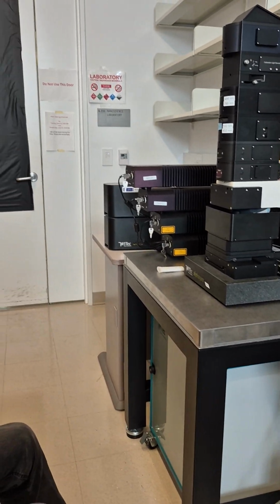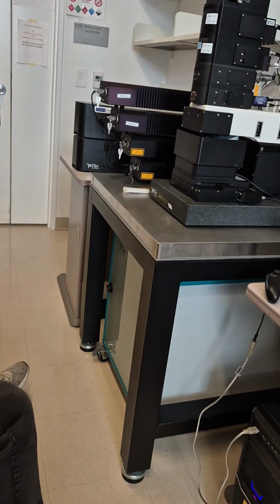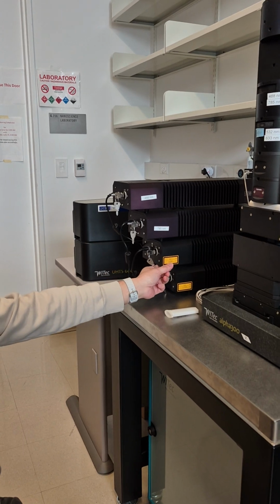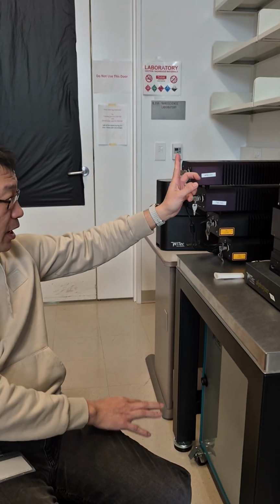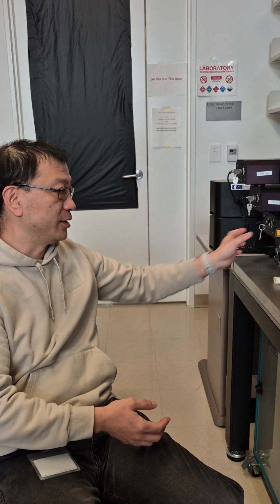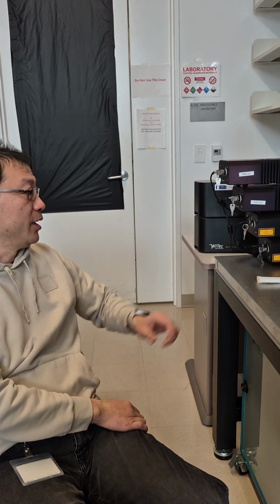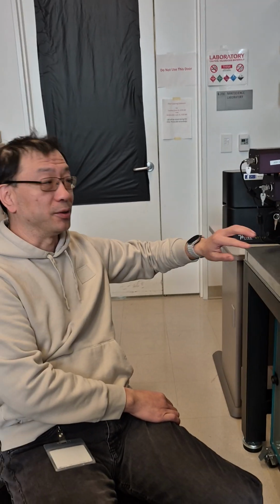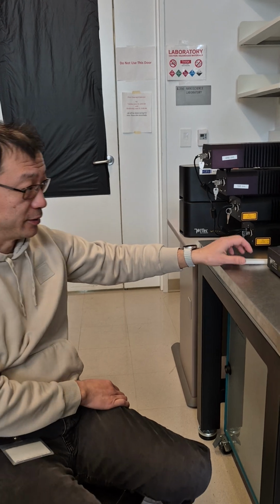So like I said, operation of the lasers are all the same. Today I'll show you the 532 laser. This is the most popular one. If you need others, you just switch others on. I usually suggest if you don't know which laser you're using, you just start with the 532. This one is turned on, and the rest of the lasers are off. So we just keep it for this one, it's on.